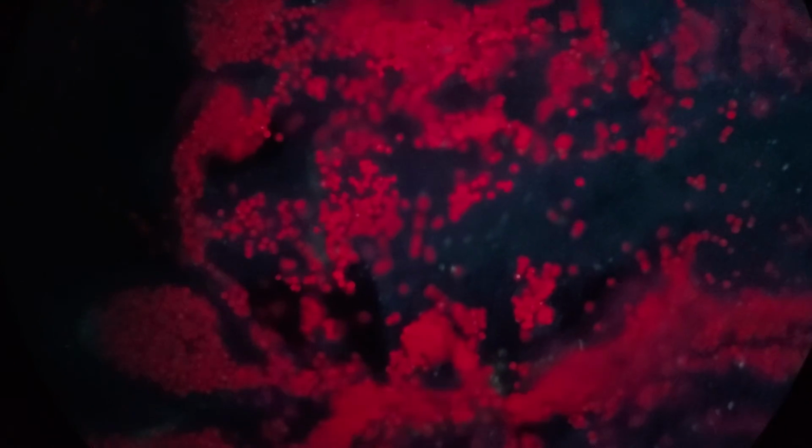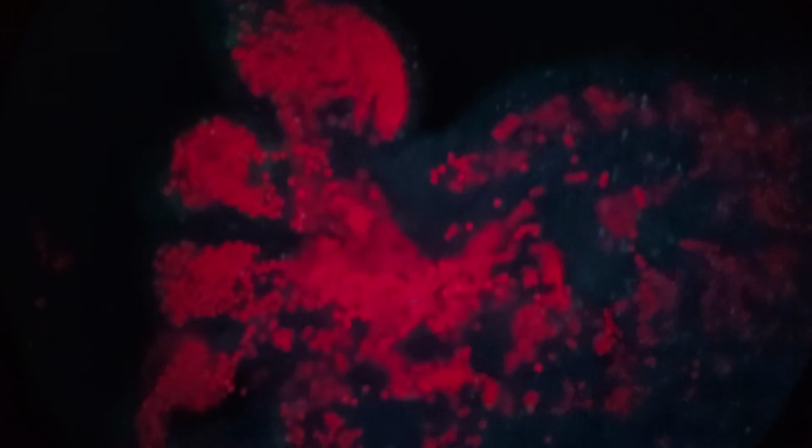But it's violet excitation. Now we're going to shine UV on it. Let's see, I think it'll look kind of similar. Yeah, a little similar. There's some now blue excitation happening, but it's very dim. But the algae are very excitable, right? They can glow red under a lot of different lights.